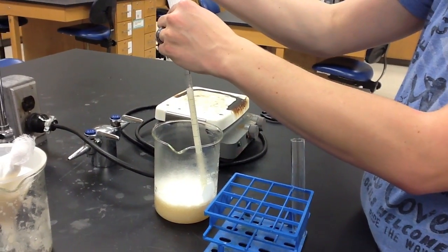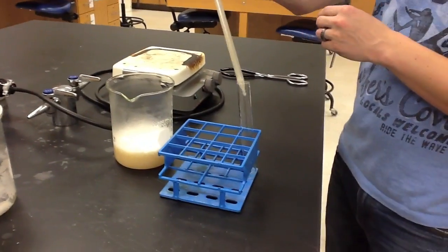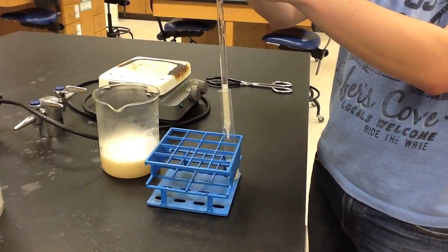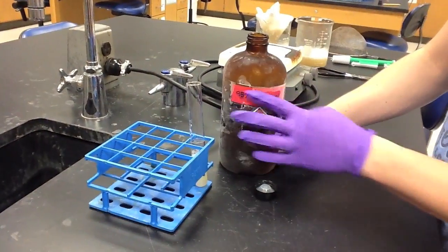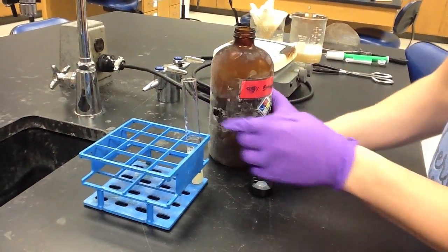We then transferred 10 milliliters of the solution to an empty test tube, and we then filled that test tube with ice-cold ethanol.